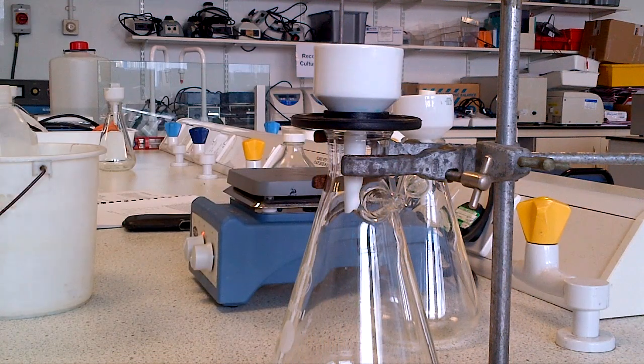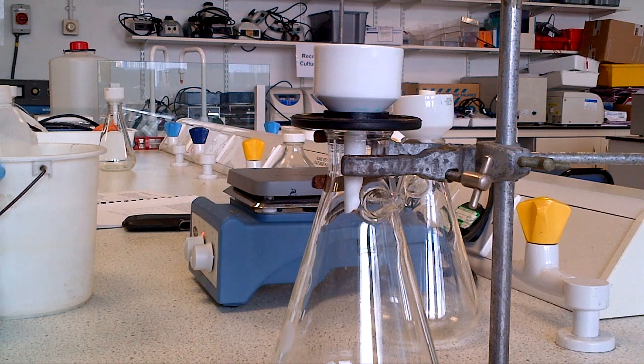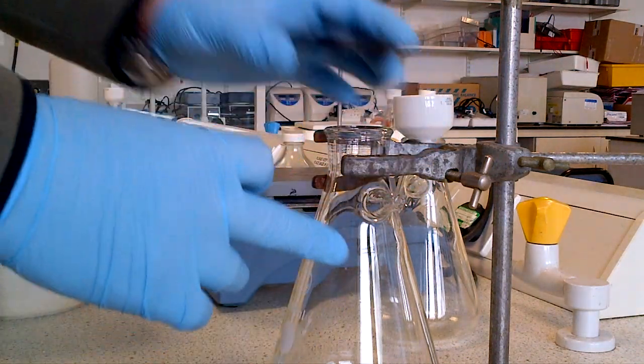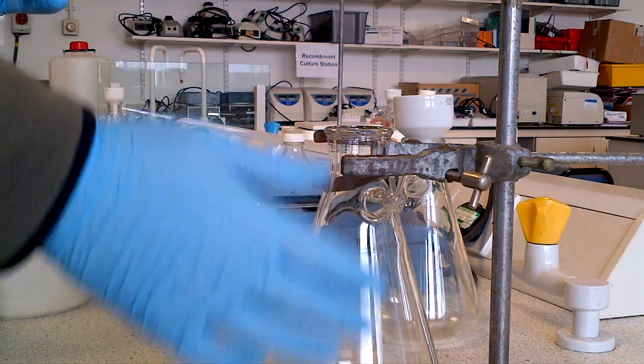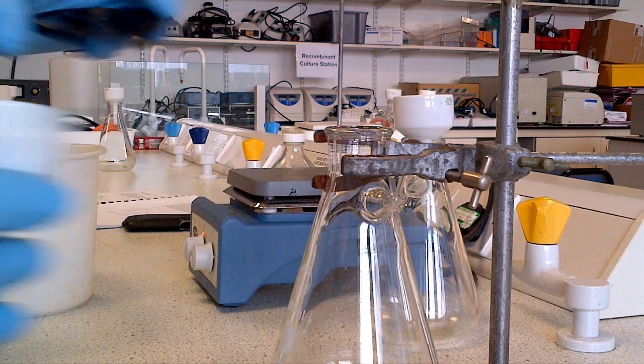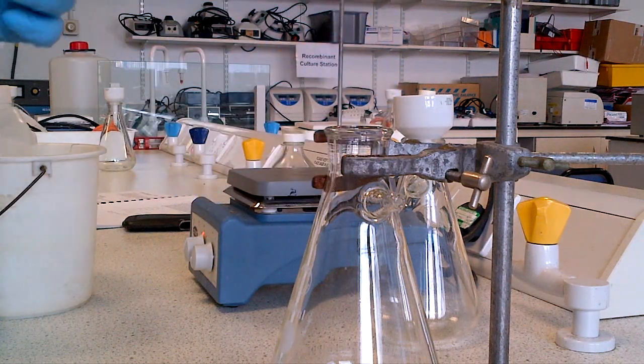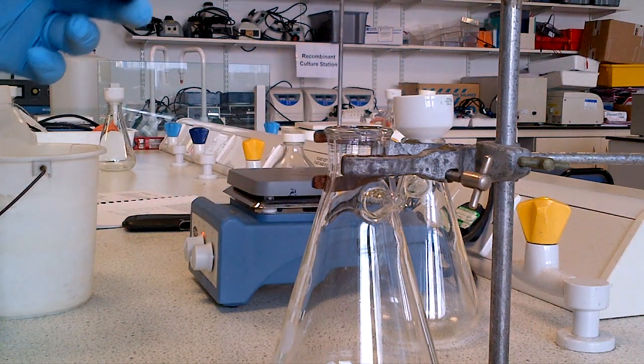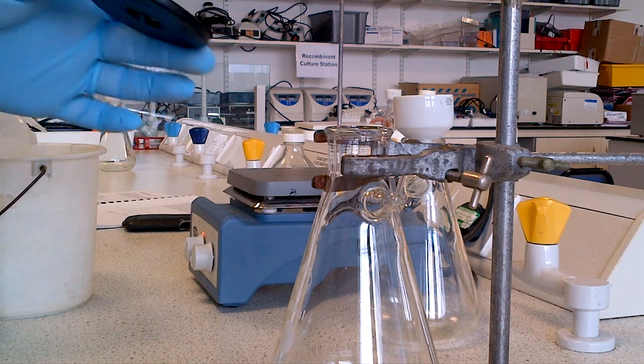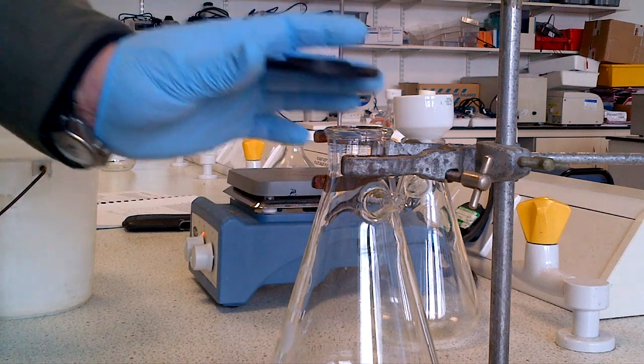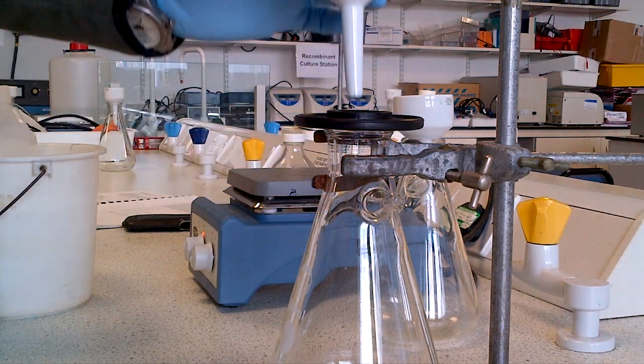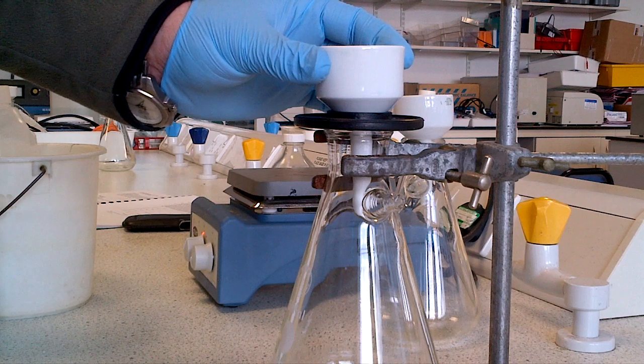To filter, you use this apparatus here, a Buchner flask and a Buchner funnel with an o-ring. Information on how to set this up is found in a further video file that you should have access to about how to filter by the Buchner funnel.